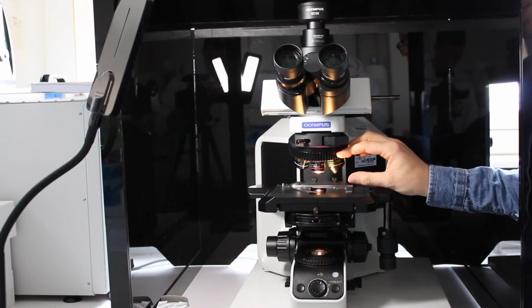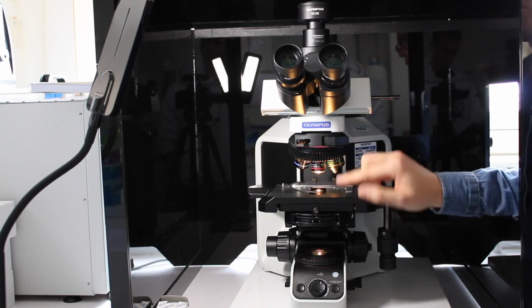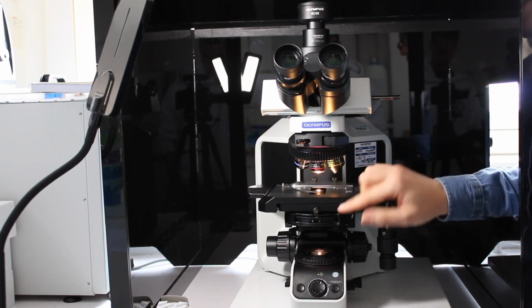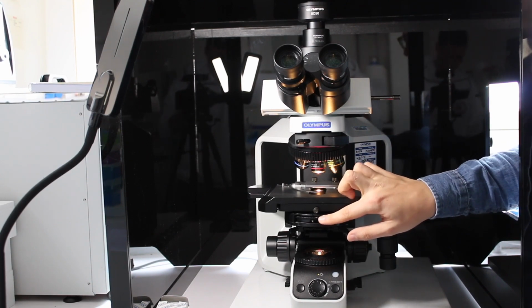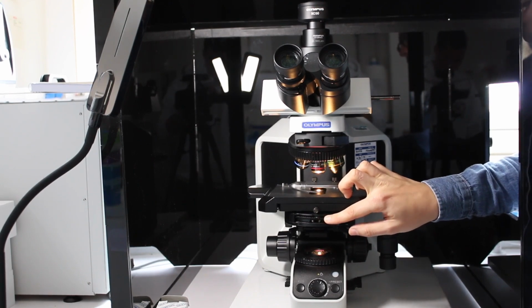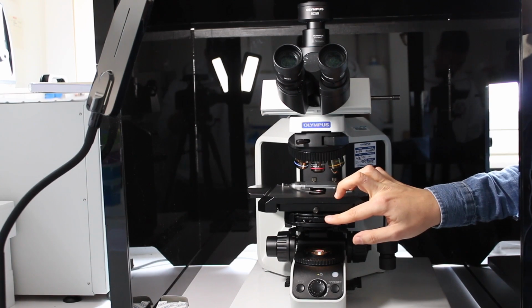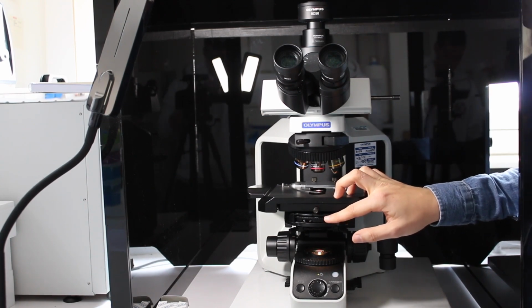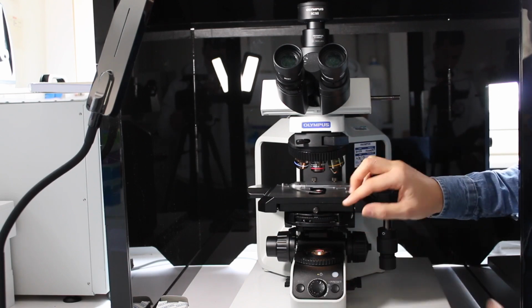Once you've chosen your objective and placed your sample, you can decide which mode you want to observe your sample in. For that, you would have to turn the wheel here. So 0 is bright field mode, the normal mode of microscopy. And then there is dark field, which is DF. That's useful to observe a sample that doesn't have a high refractive index difference compared to the solvent, but that scatters light quite a lot. For example, if you're looking at capsules.